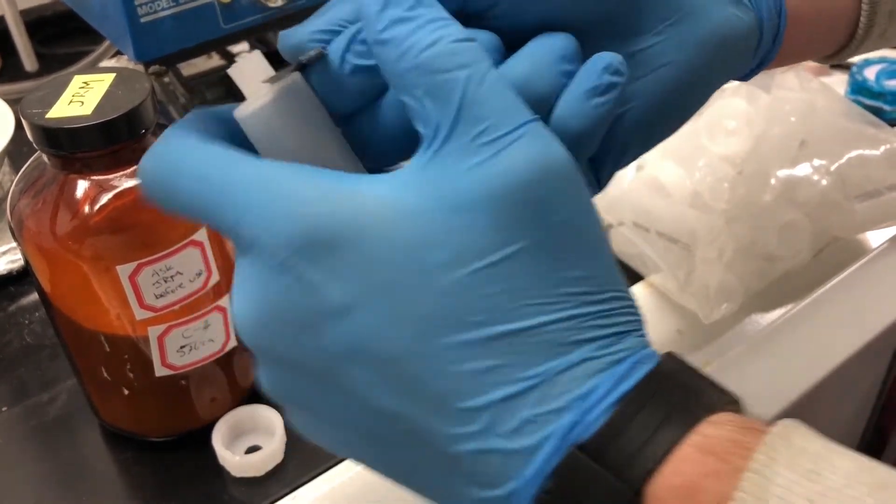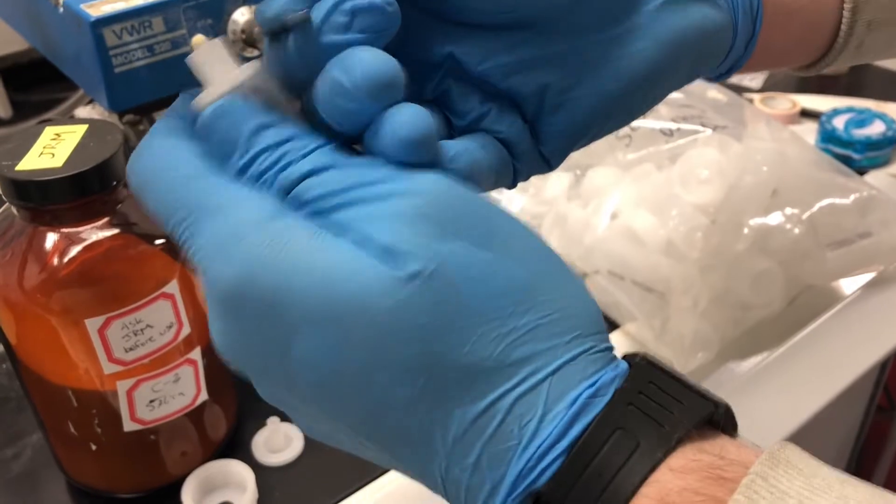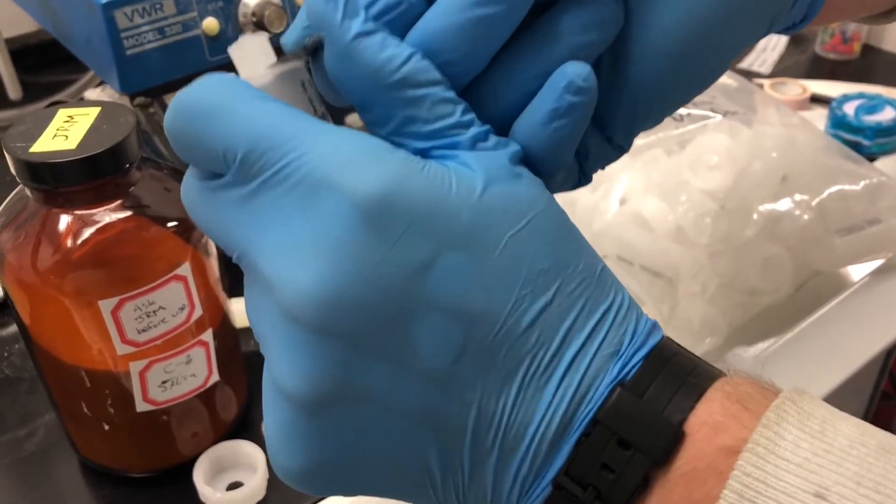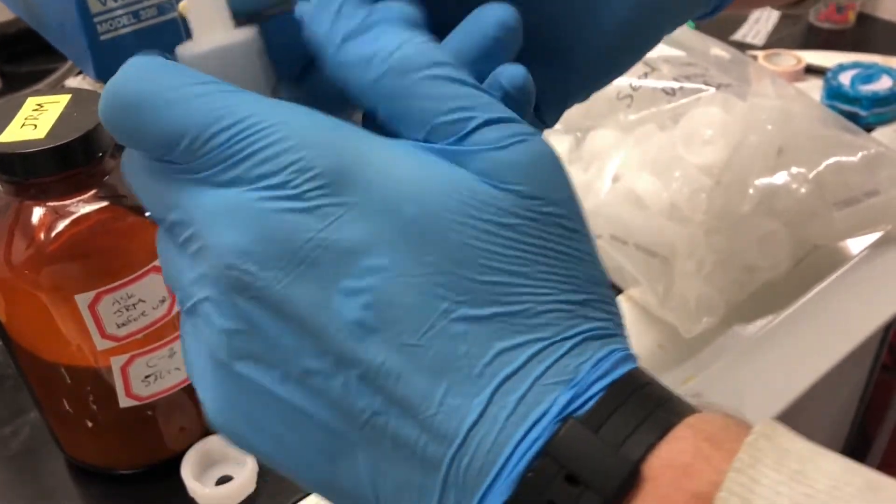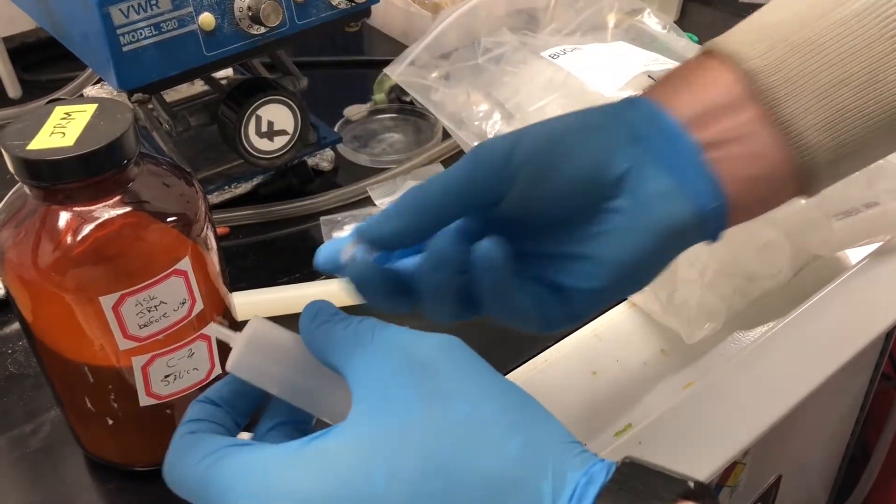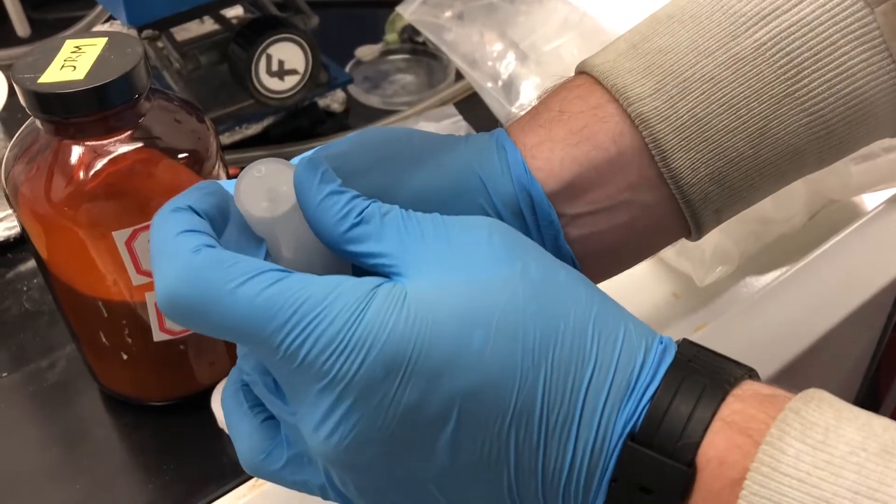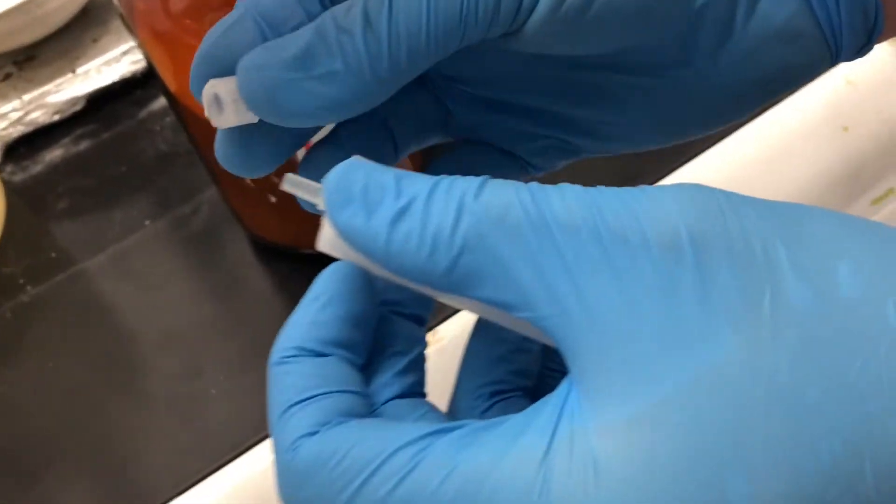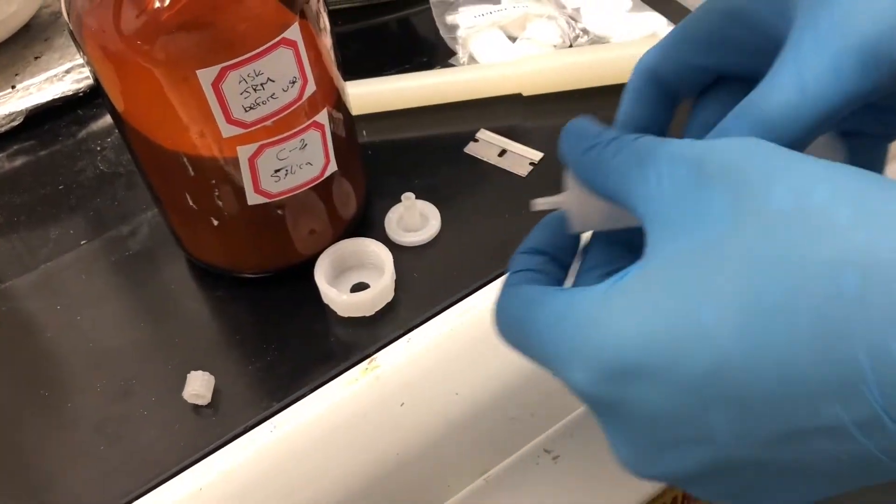Once you go all the way around it's easy. Top off. Make sure you didn't crack the bottom. Right, we didn't. Just get rid of that, it's trash at this point.